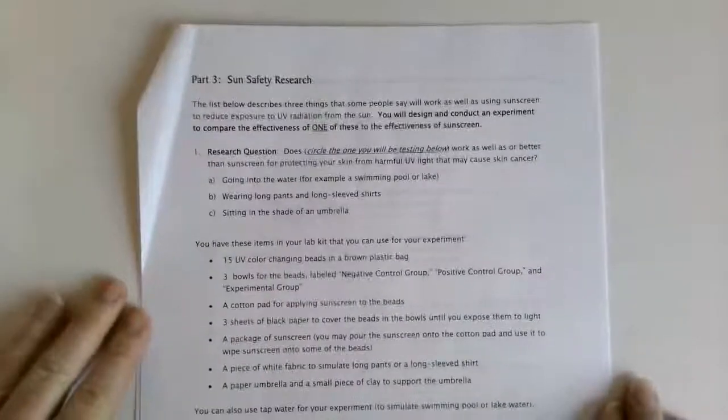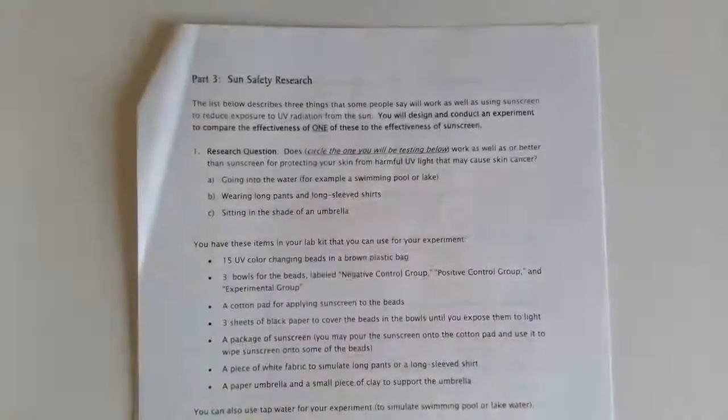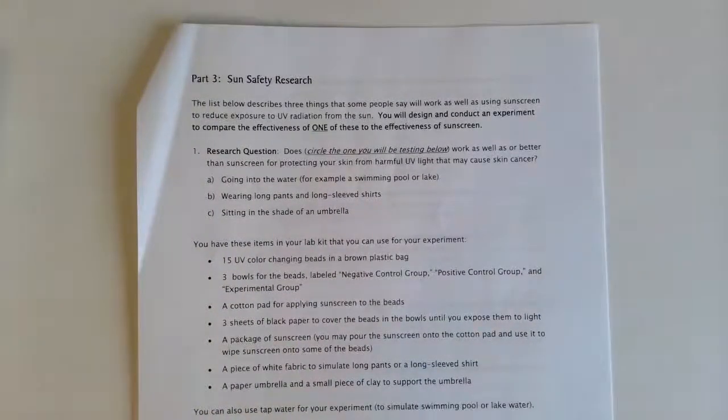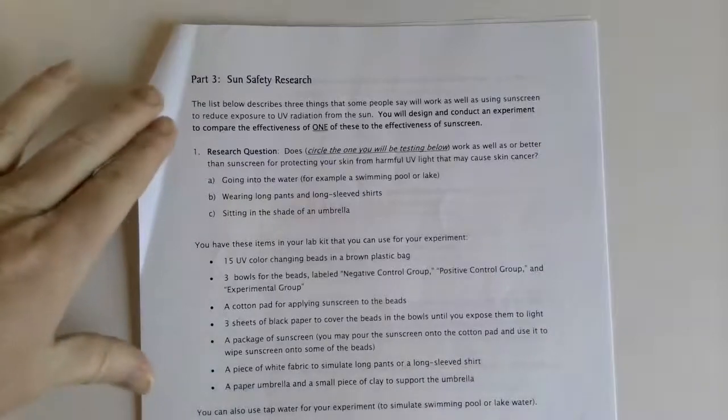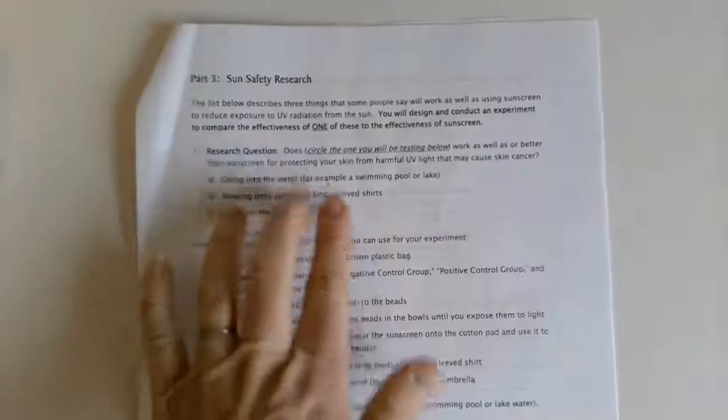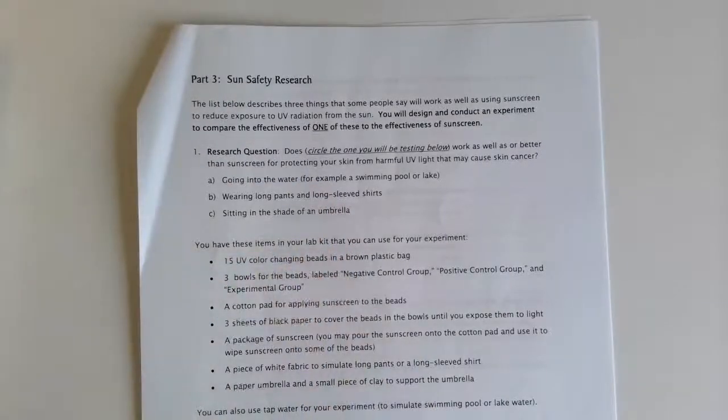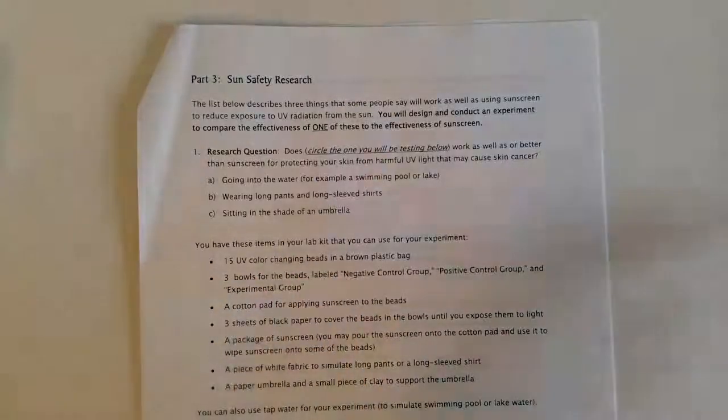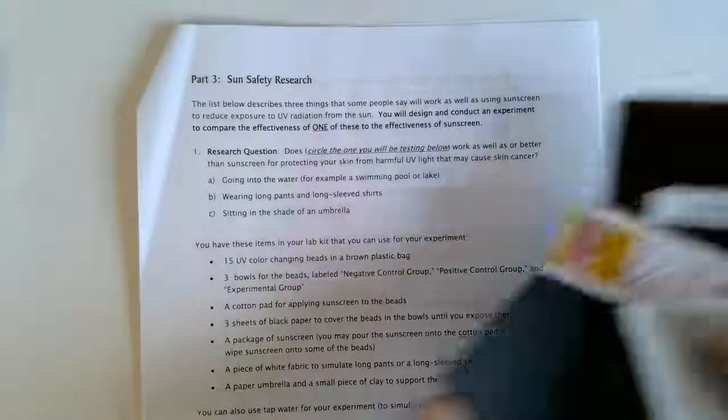Now we're going to be in part three, talking about sun safety research. I really like this part of the lab because this is where you will do your own experiment. Here you will have a research question that you will pick, and then you're going to use these different items that are included in your kit.